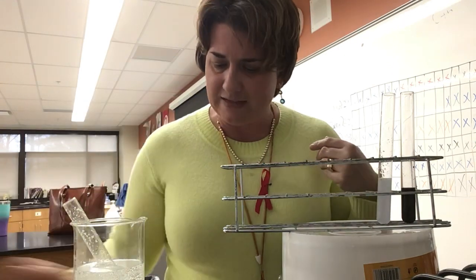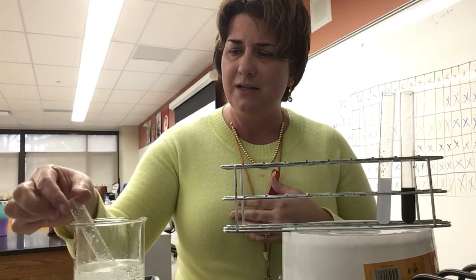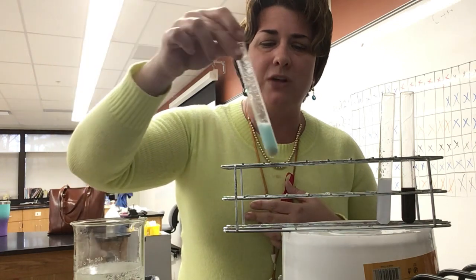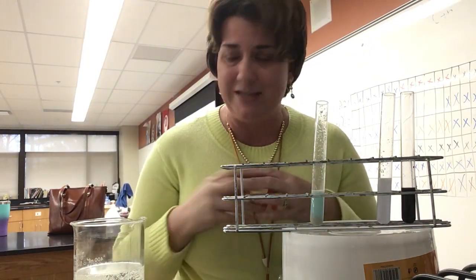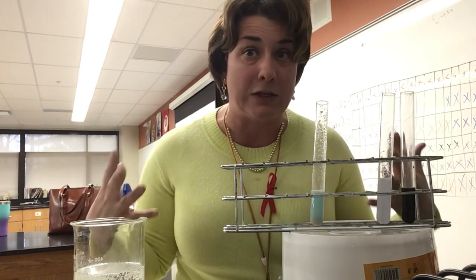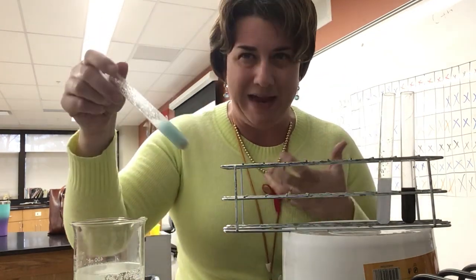Now let's take a last look here at our Benedict's. That's the one that tests for sugar. Let's see if I can get this with my fingers. So again, that spent some time in there. Down at the bottom, what I'm starting to do is actually cook my reaction. The brown that you're seeing at the bottom is because there's food particles floating in there, and when you expose them to heat, they start to brown. But my actual tube itself remains blue.